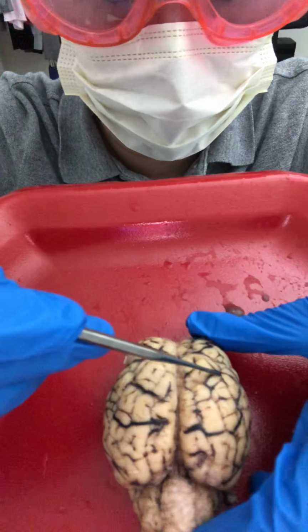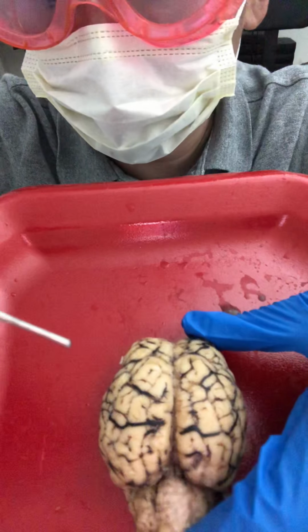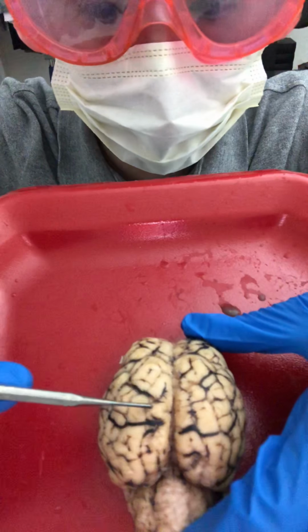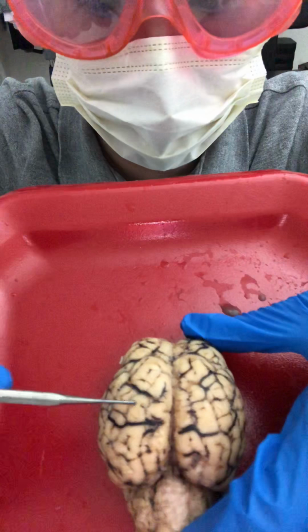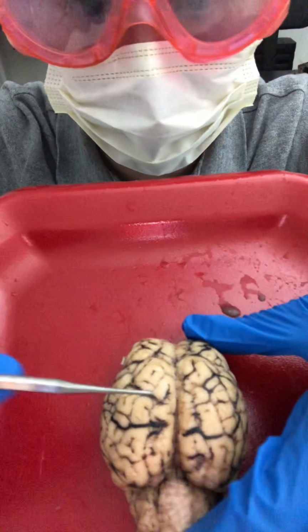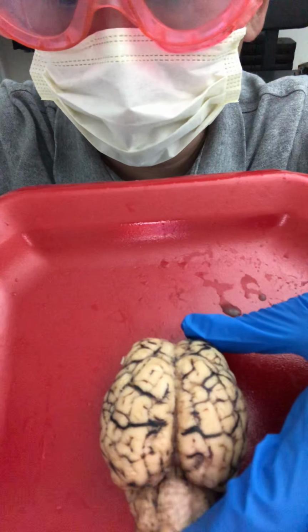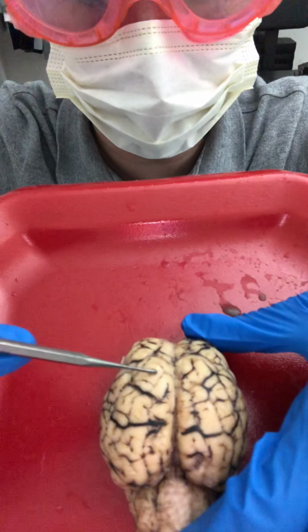You see these black lines here? That separates the different parts of the brain, and that's referred to as sulcus. This black line here, as I'm pointing to, is a sulcus. The folds of the brain, as I'm pointing and going in the same direction as those, are referred to as gyri, the end of the fold. So again, I'm going along these folds. These are gyri, okay? And that was it on the top part: longitudinal fissure, sulcus, and gyri.